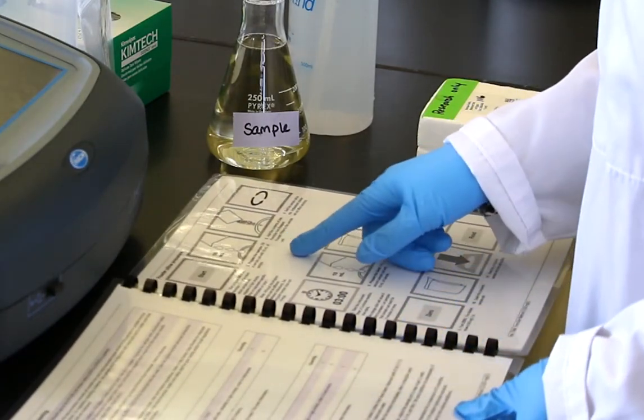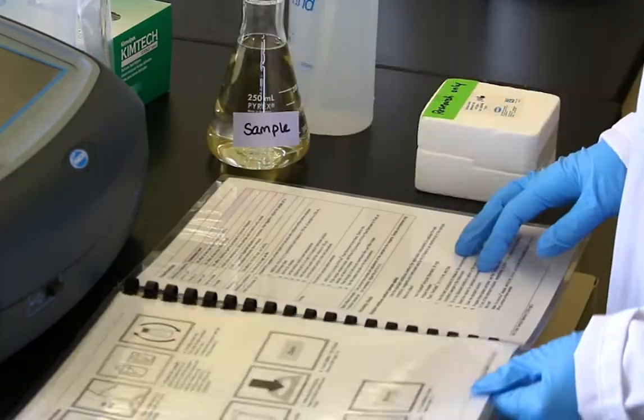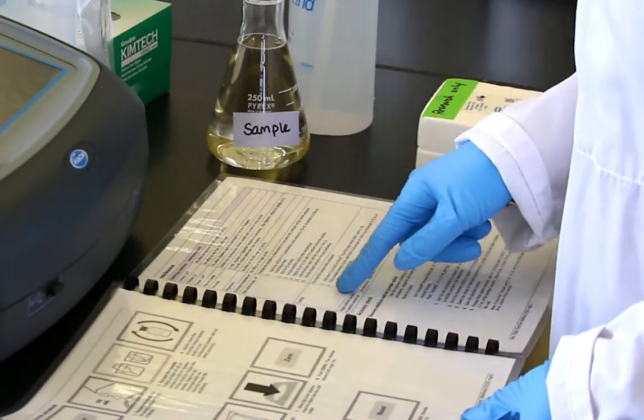Be sure to review the safety data sheets for the reagents and use the personal protective equipment that is recommended.